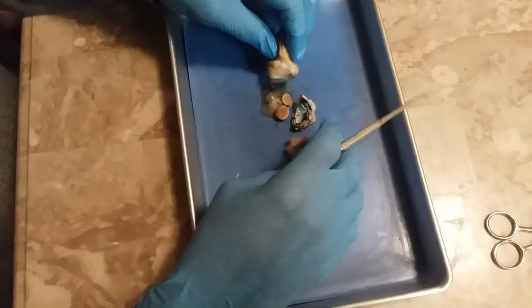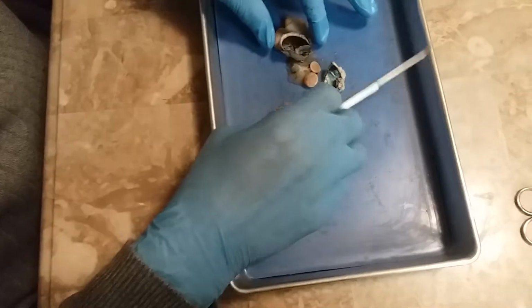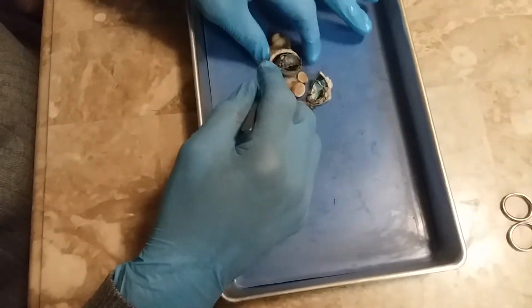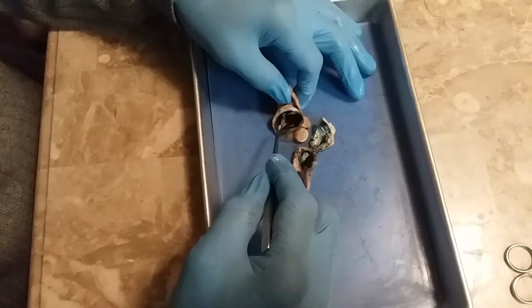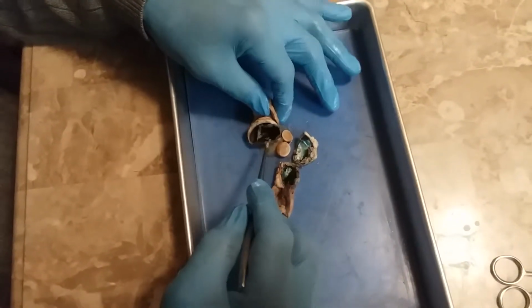The dissection will start with the external and the interior of the cat eye, and we will be identifying the aqueous humor, the clear fluid area between the lens and the cornea, composed mostly of water, which helps maintain the shape of the eyeball.